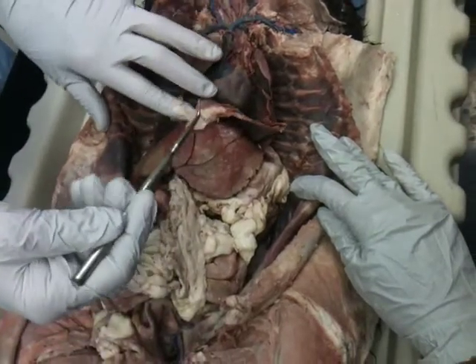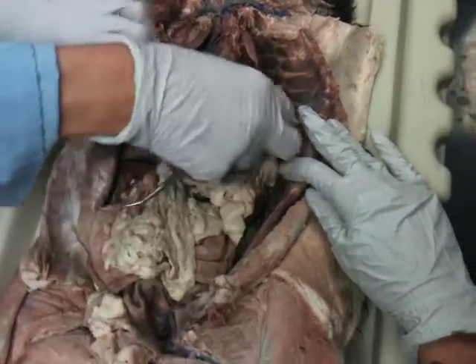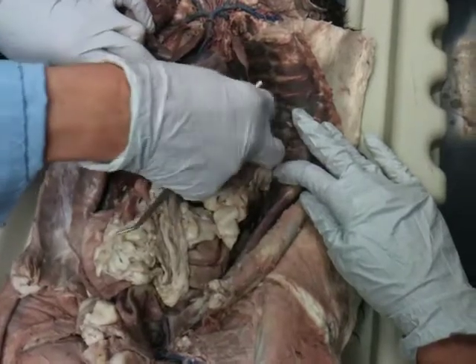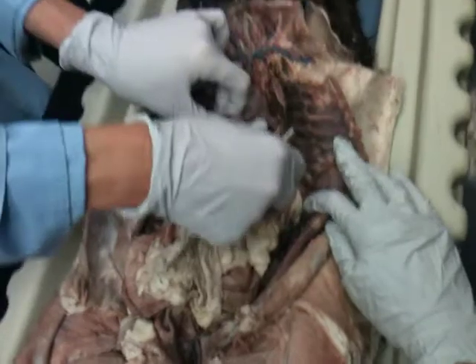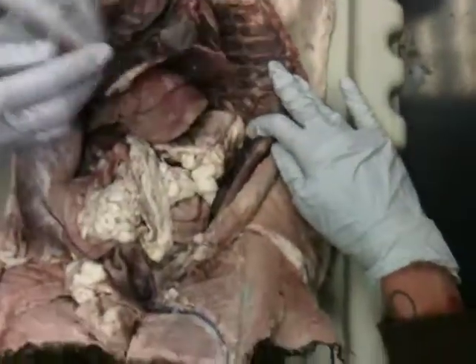What's up? We're taking a picture. That's not a bad idea at all. Someone else had done it, and they were going to put some on Blackboard, so check that. Okay. So diaphragm here.